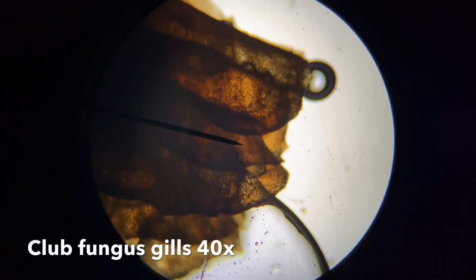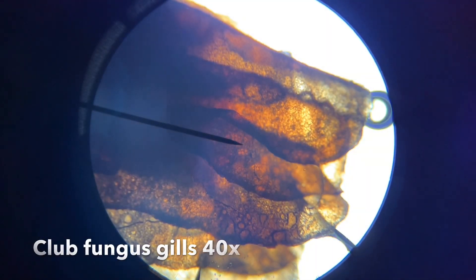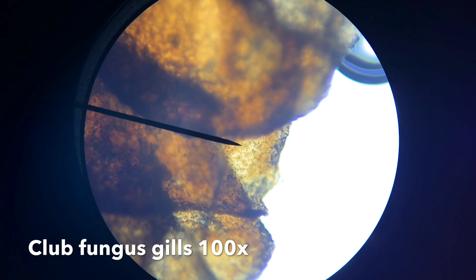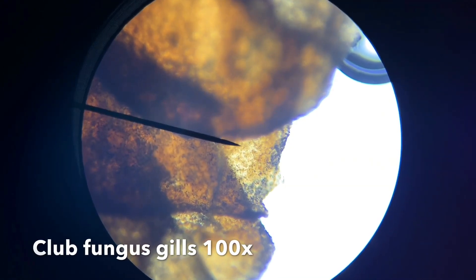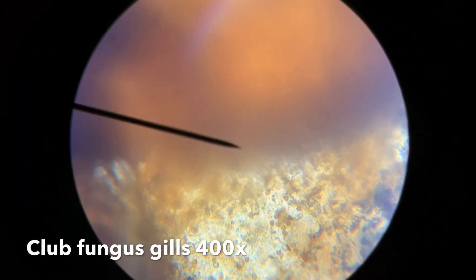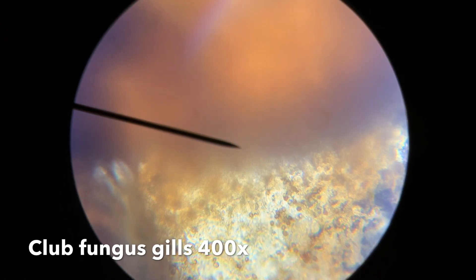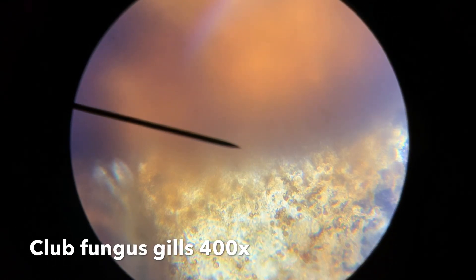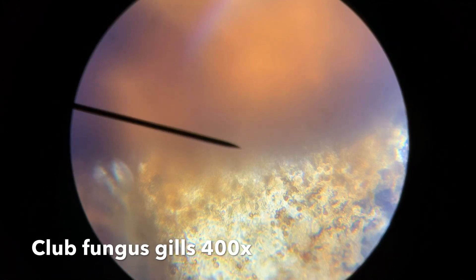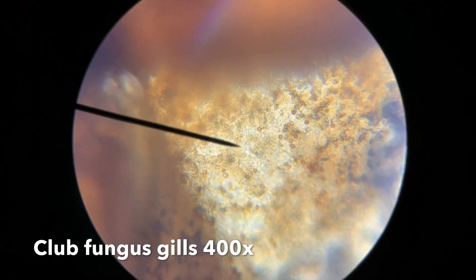First we're going to look at the gills, and we'll bring the gills up. You see the spores? You can see the spores on the lower half of the slide — those little circles. So this was a mature mushroom.